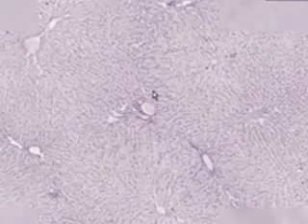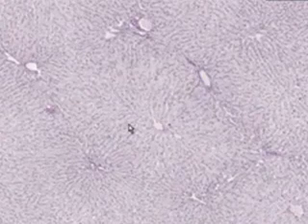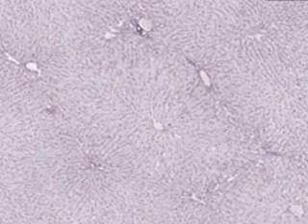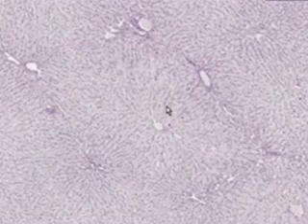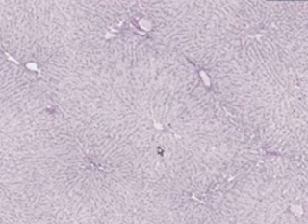So here we have, I hope you can understand that this is the basis for understanding all liver histology. The portal veins, which are large spaces with connective tissue, the central veins, which are large spaces with no connective tissue, these little streaks between the two, which are the hepatic cords consisting of only hepatocytes, the spindly cells, in contrast to the perfectly round central nuclei of the hepatocytes, which are the Kupffer cells.